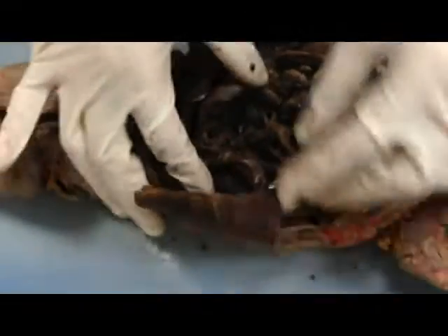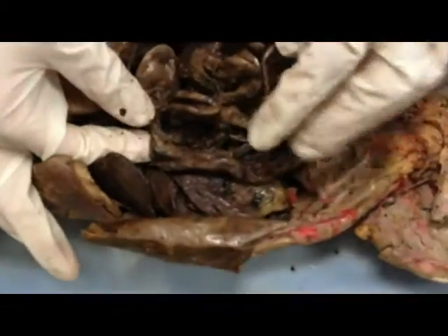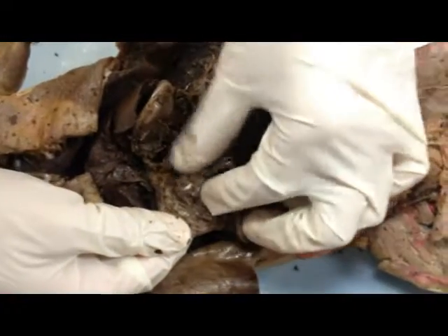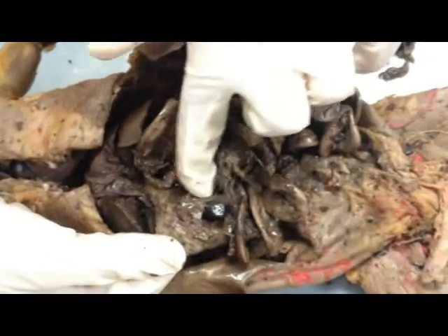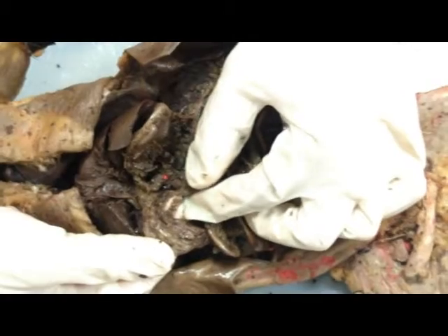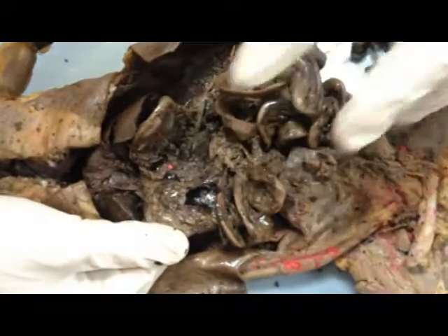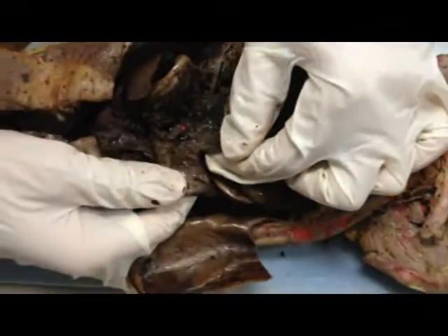The pancreas is actually a lot easier to find than the gallbladder. The pancreas is connected to the duodenum. So you have the stomach, you have the duodenum, and if you see something that sticks out — this right here would be the pancreas. It's a little brown, and it has a different consistency than the rest of the other tissue around it. It connects straight into the duodenum, so this right here is the pancreas.